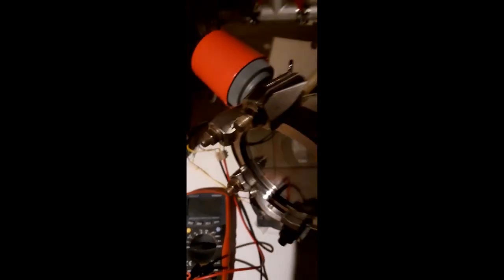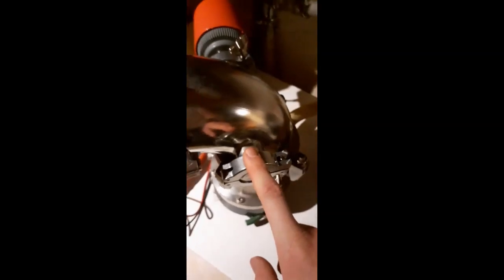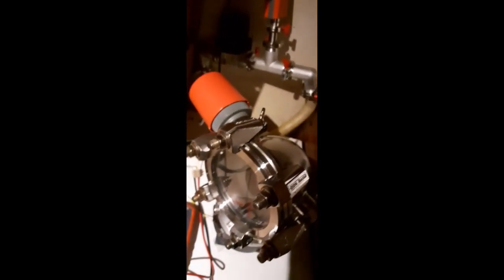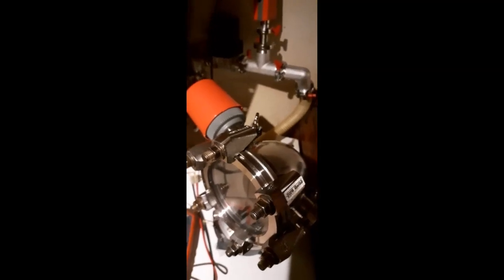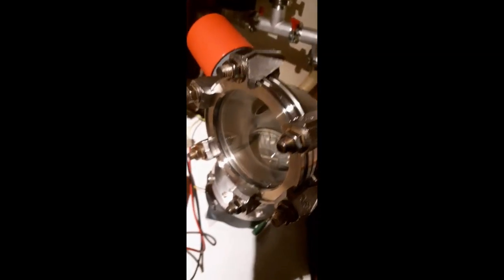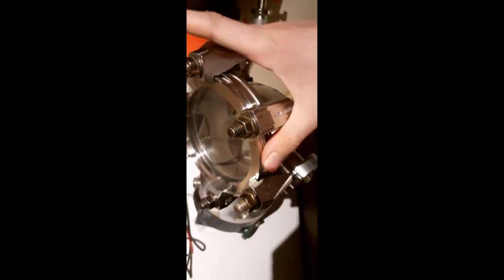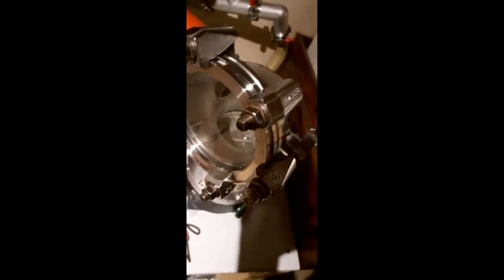So that's the setup, and I have this port here where I can introduce electrical feed-throughs, or I could use a flexible hose or do whatever. I could mount anything on here I wanted. At some point, I'd also like to get a blind flange here, so I can use a bell jar, so I have a base plate I can add stuff to. That's an easy way of making large setups, just build them on the plate here and mount them. But for now, this is perfectly workable.